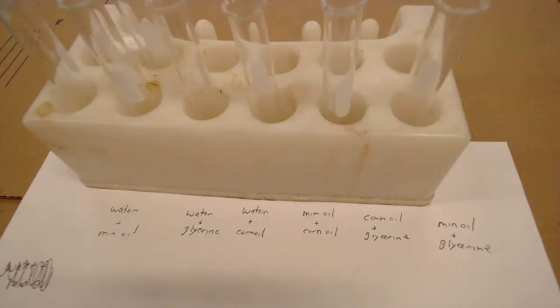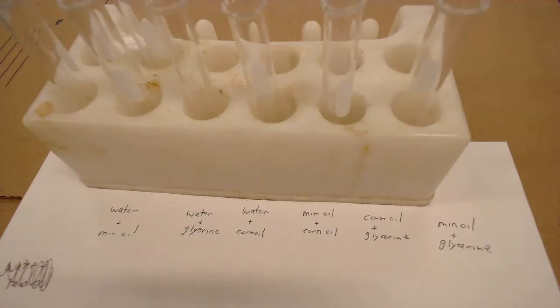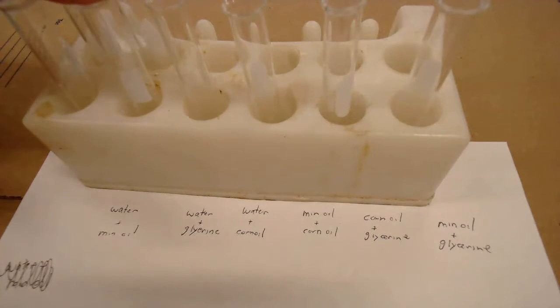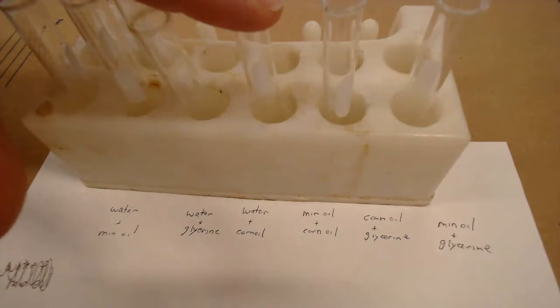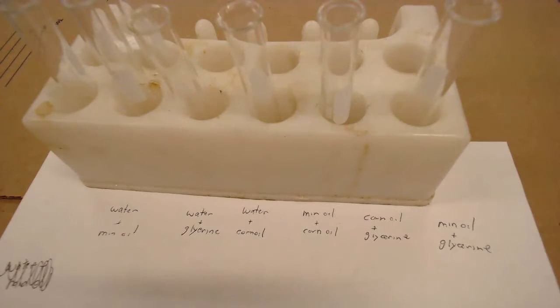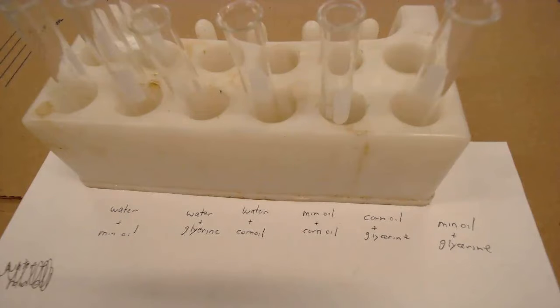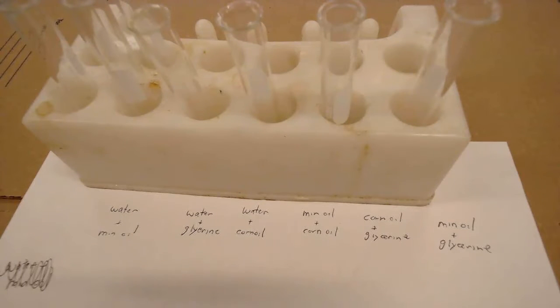In the second part, I'm going to add three milliliters of water and three milliliters of mineral oil to my first two tubes, then three milliliters of water and glycerin, then water and corn oil, then mineral oil and corn oil, then corn oil and glycerin, then mineral oil and glycerin. We're going to shake them up and see if they mix together. If they mix together, we call them miscible. If they do not mix together, we call them immiscible.